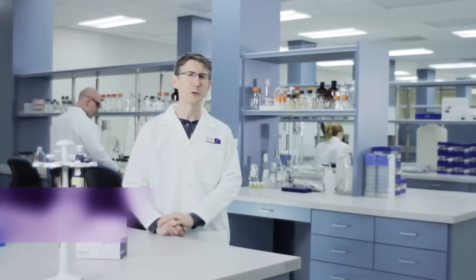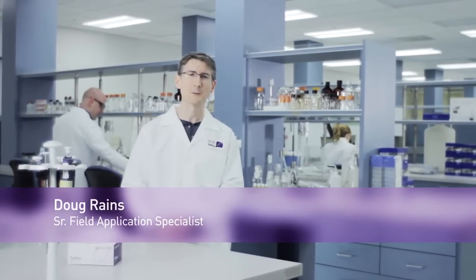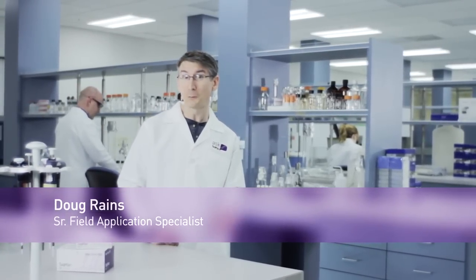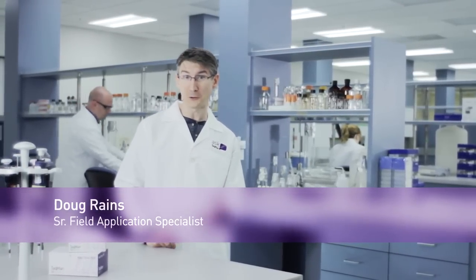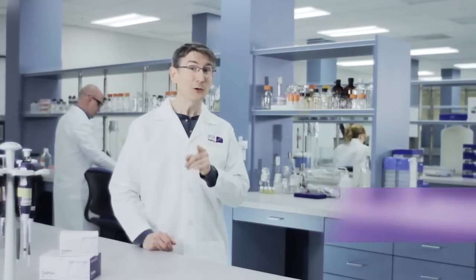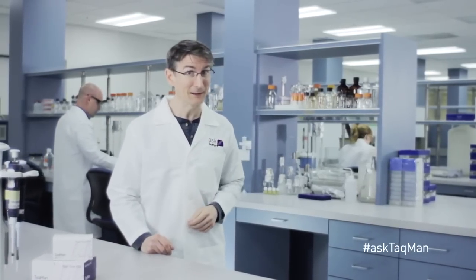Are you using SYBR Green chemistry for your real-time experiments and getting multiple peaks in your melt curve? Are you asking yourself, is this a bad thing? Let's start with a little background. Unlike yours truly, SYBR Green chemistry is a free-floating dye.